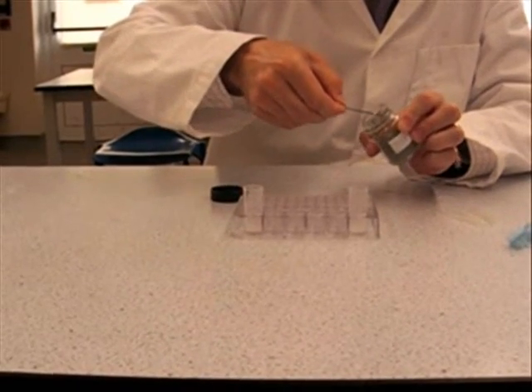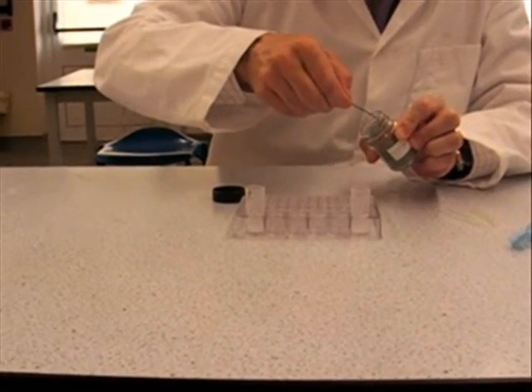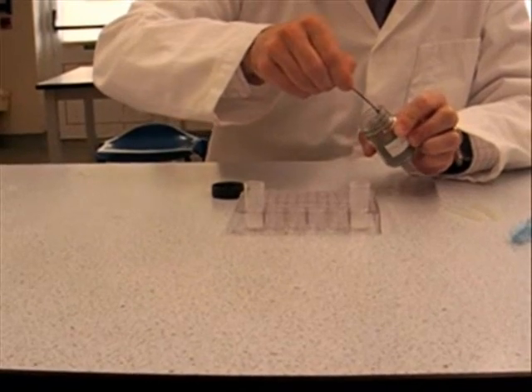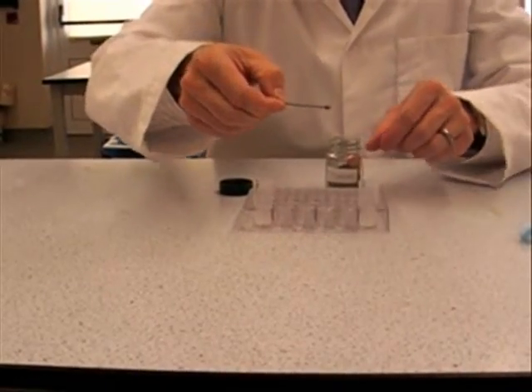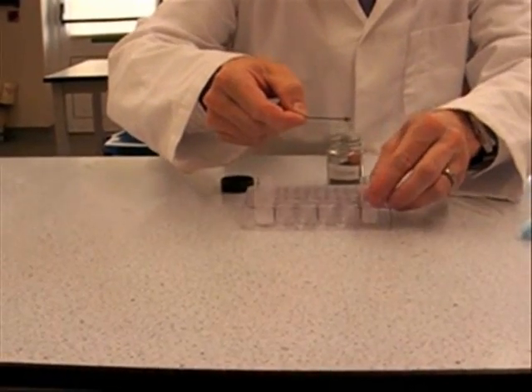First thing we're going to do is get one of these micro spatulas and get some zinc powder. And you need a level spatula of zinc powder. So that's too much, so we're just going to wipe it against the edge.